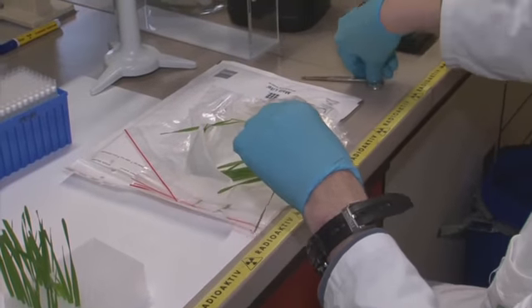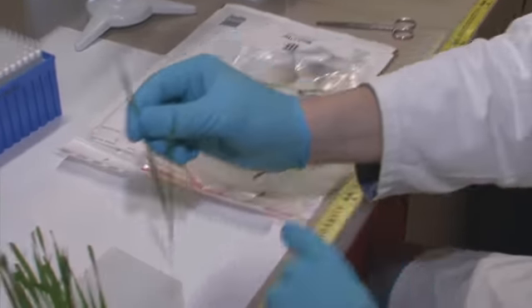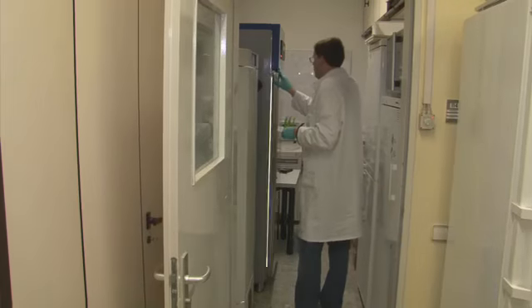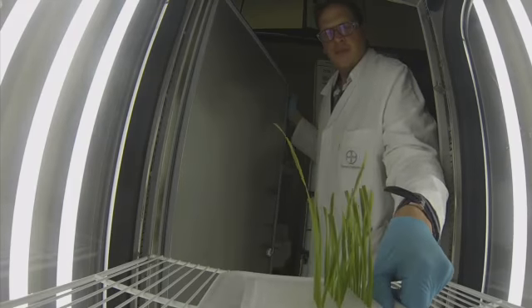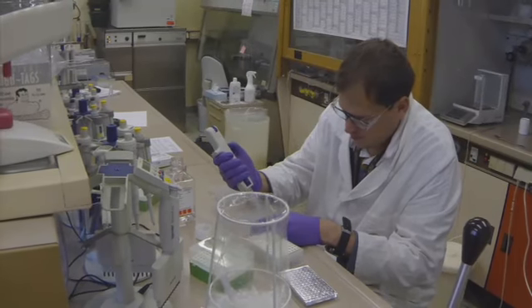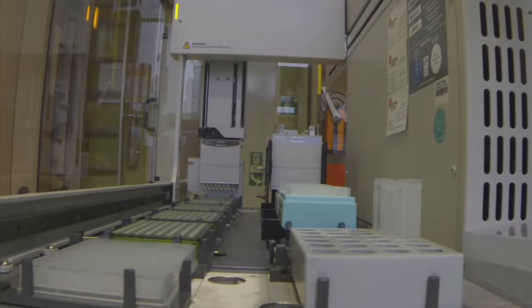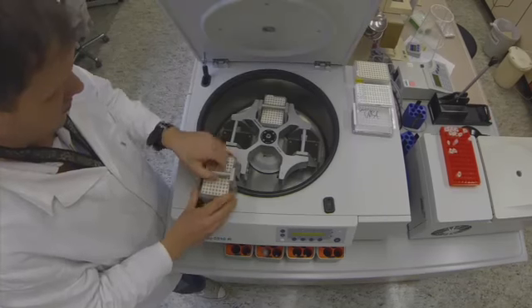Testing for metabolic resistance involves incubating the shoots of plants with suspected resistance by leaving them to soak for approximately one day in a solution containing radioactively labeled active ingredient. The sap is then extracted from the shoots.